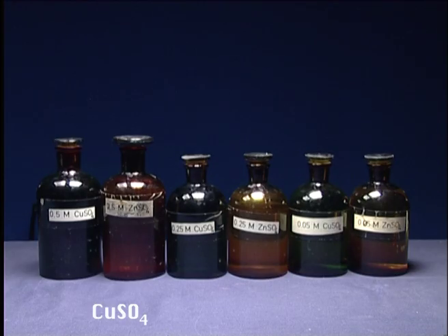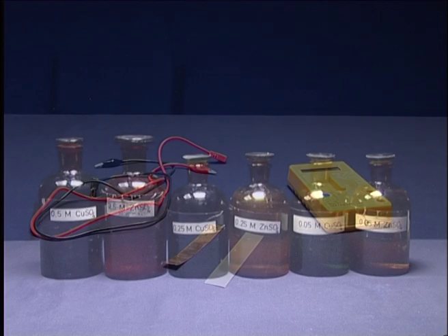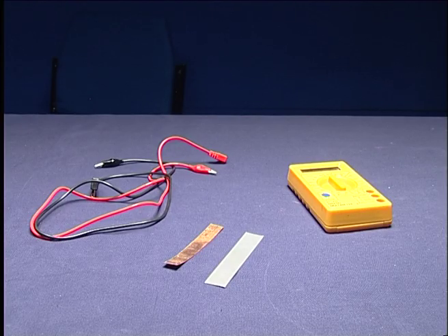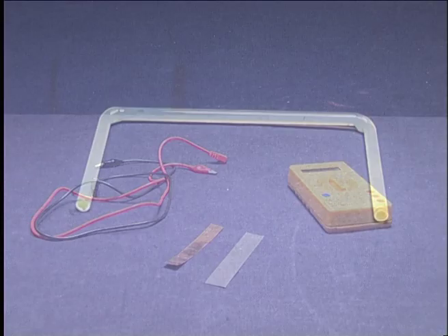Copper sulfate and zinc sulfate at different concentrations, multimeter, copper and zinc strips and wires, salt bridge.